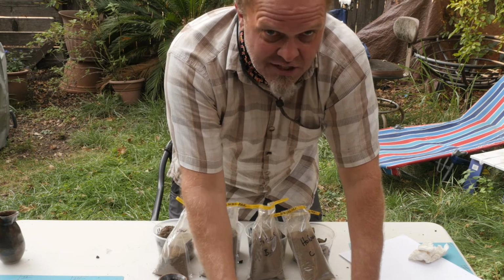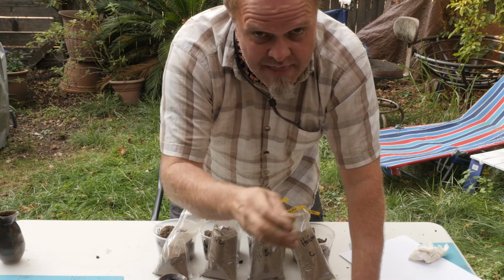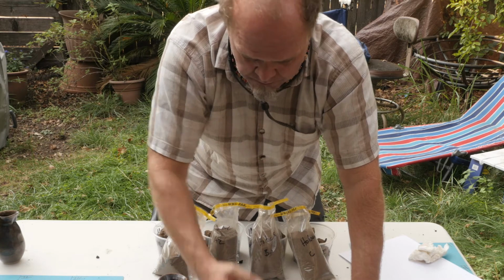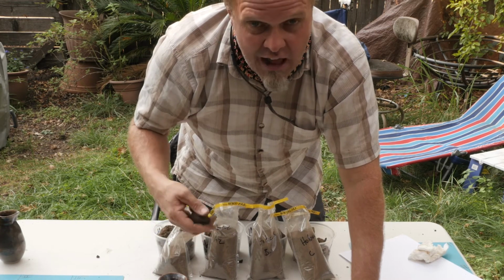I also haven't textured a lot of soils lately, so the amount of sand that was in my hand there might be considered very gritty, and that would have taken us down the path more toward the loam or a sandy loam. This being a clay loam, I suspect might be a little bit off in our calibration.